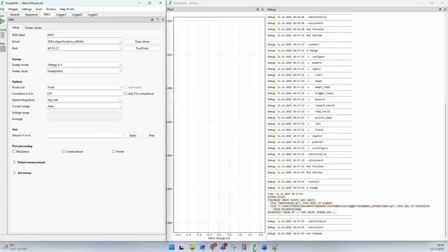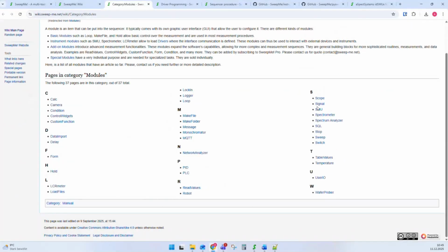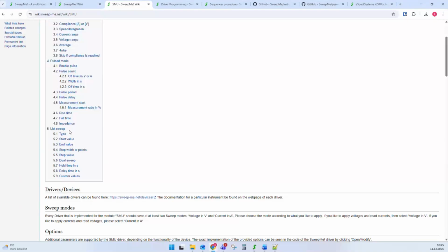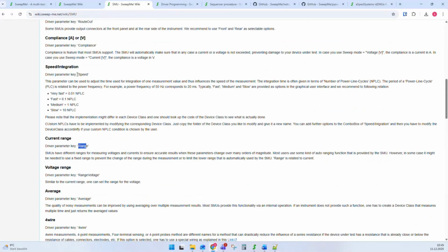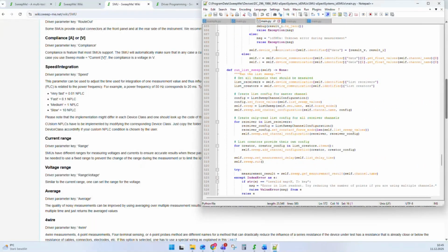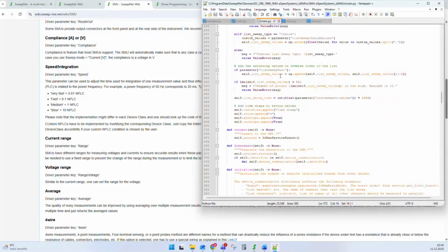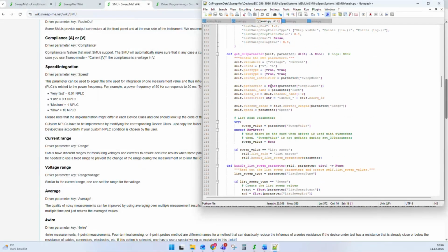Here it is the same procedure. These keys are defined or described in the wiki. We can go here to modules and SMU. And you can see that we have different options. And you can then see what the driver parameter key is, like range, voltage range, speed, and so on. And this means if you go into a driver for an SMU module, we already had one open here for the SMU from Aspect Systems. When we go to these functions, setGUIParameter and getGUIParameter, you can see that we set these GUI parameters and we use exactly the keys that are predefined by this module. And then we get these keys exactly back and can retrieve the data here, like the protection by using the compliance value from the user interface and so on.